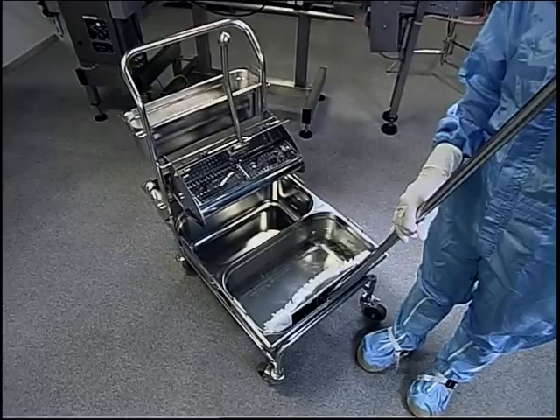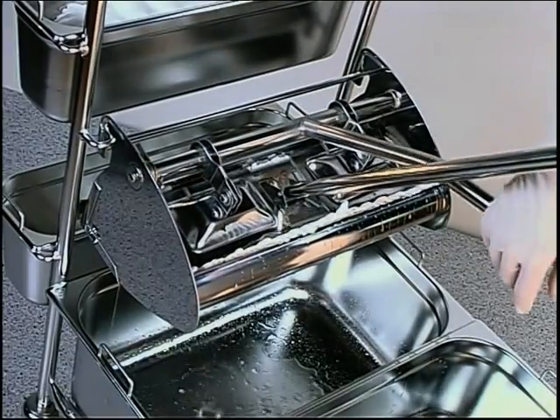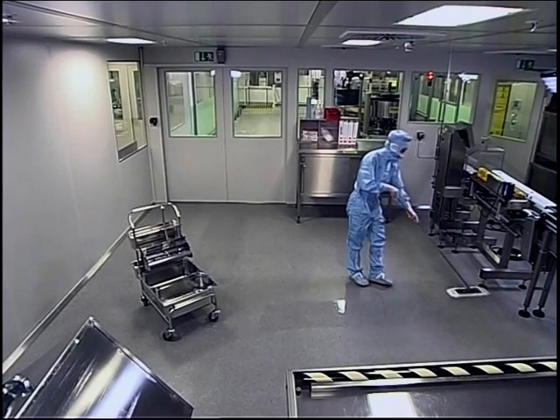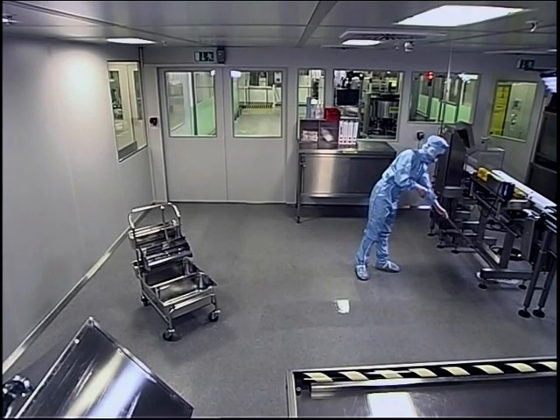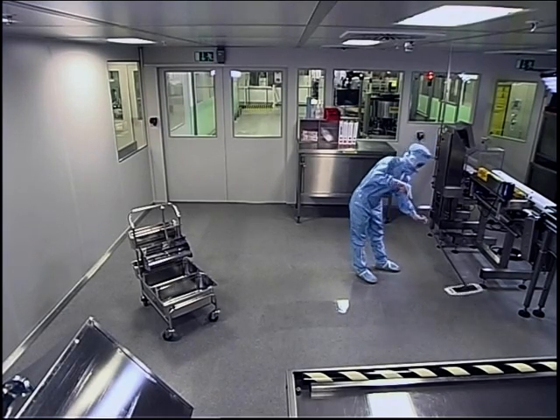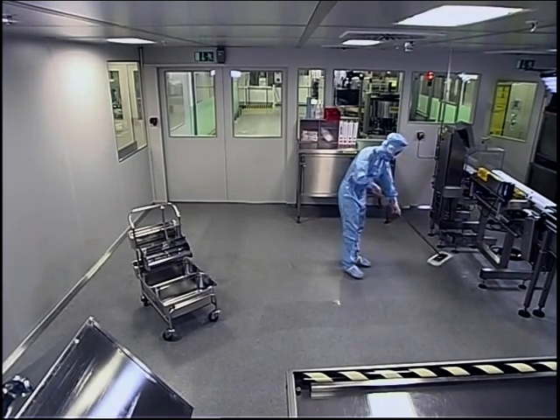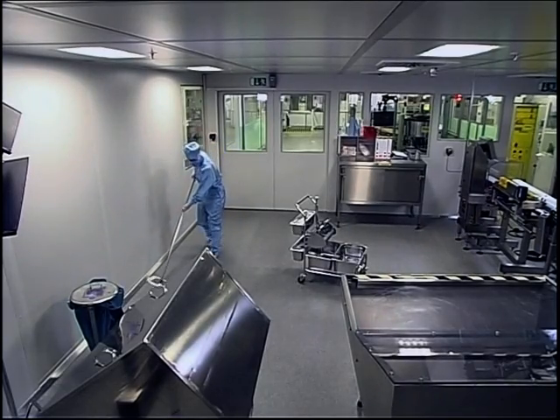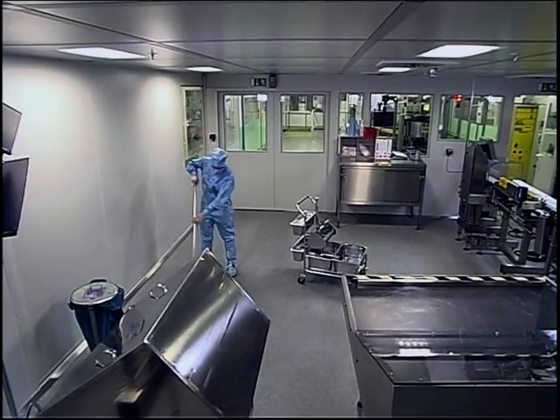The new mop cover is immersed in the disinfection solution and wrung out once. Now it's ready for use. Divide the room up into imaginary 10 square meter areas. In a divided area with obstacles, first wipe around these and along the edges of the floor. Then follows the wiping of the free surfaces.